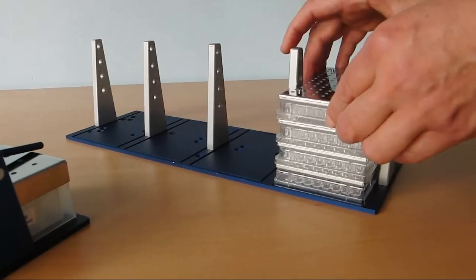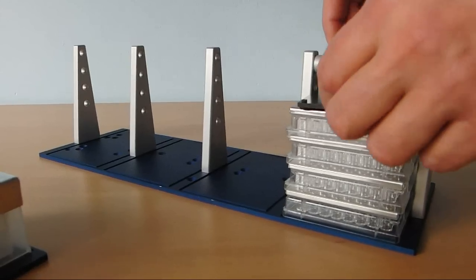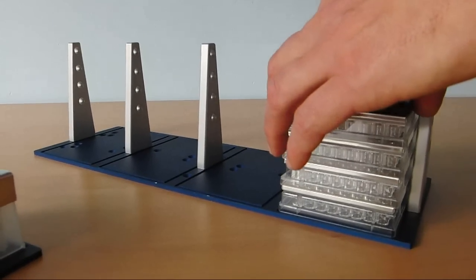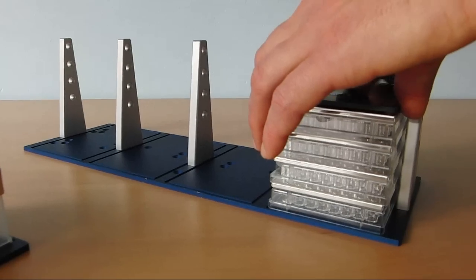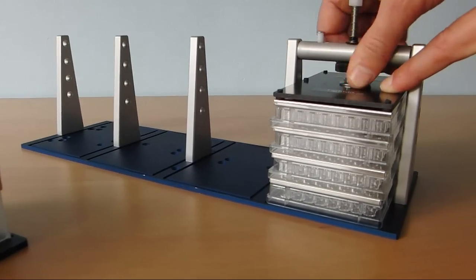Here you see how maximally four 96 low well microtiter plates can be stacked. The stack of microtiter plates, including their sandwich covers, can then be tightly screwed together using the tightening device as shown here.